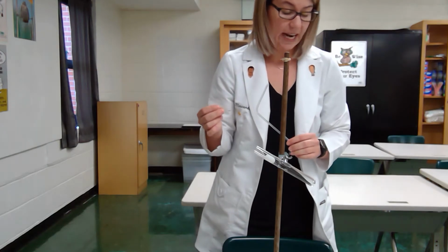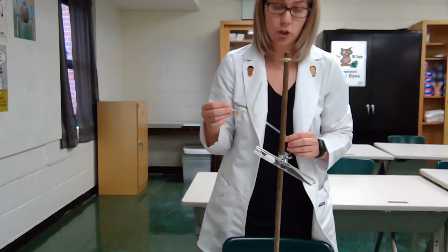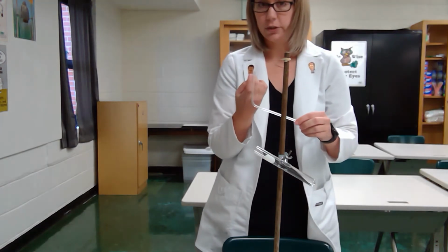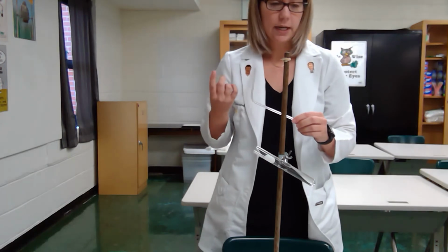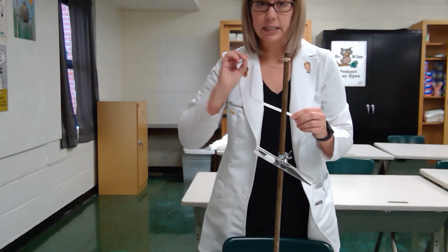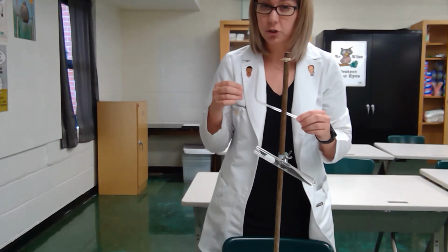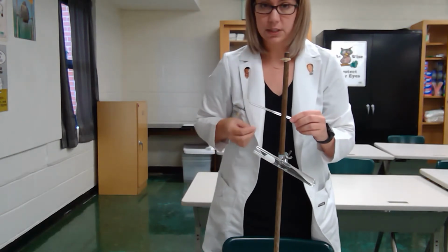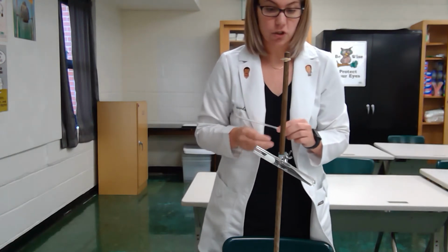And then the second reaction, for station 2, I'm going to collect a product underneath of a test tube and then ignite underneath of that test tube for the second reaction. So that combustion of the product from station 1 is going to be part of the reaction for station 2.